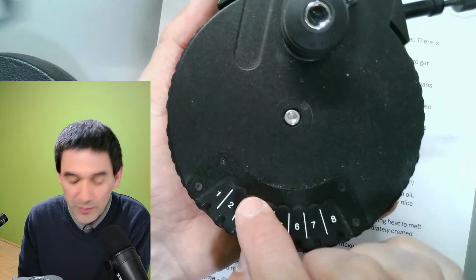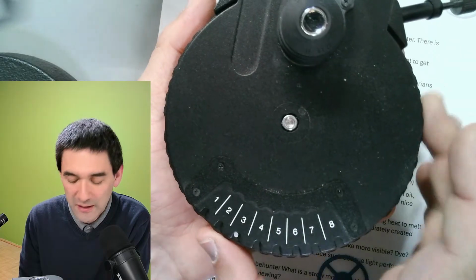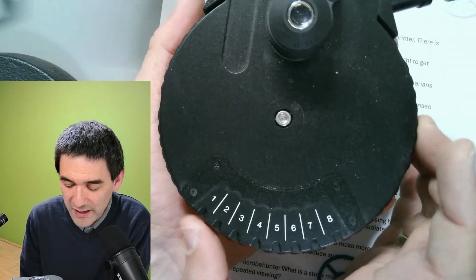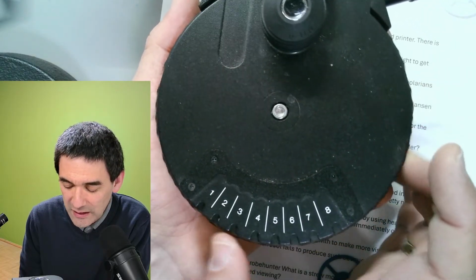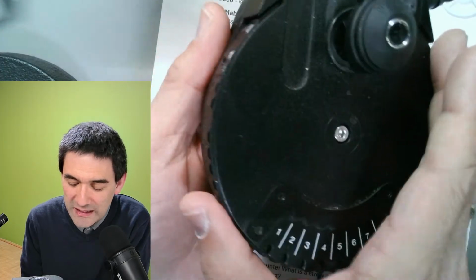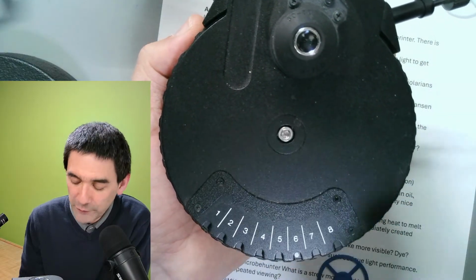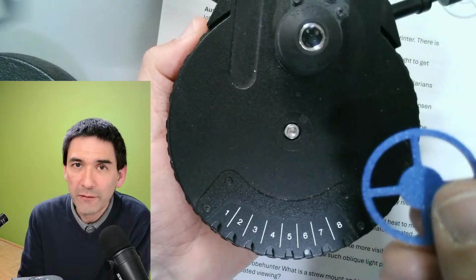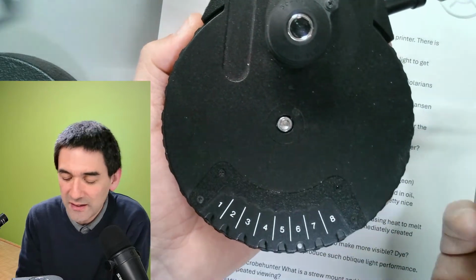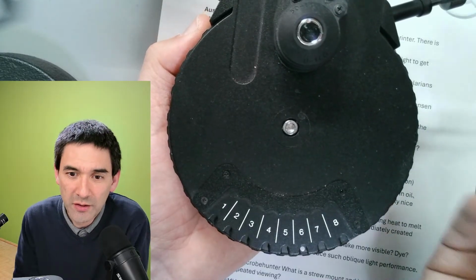And setting number 3, that is for phase contrast. Okay, and then for the different objectives, I have to have a different setting, right? And the different prisms and everything is already in here, and it's not accessible. I'd have to take it apart, right? And for this reason, I cannot insert any filters. And that's essentially the only reason why I'm using the other microscope now.